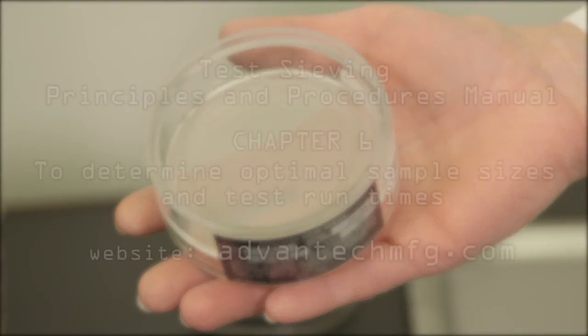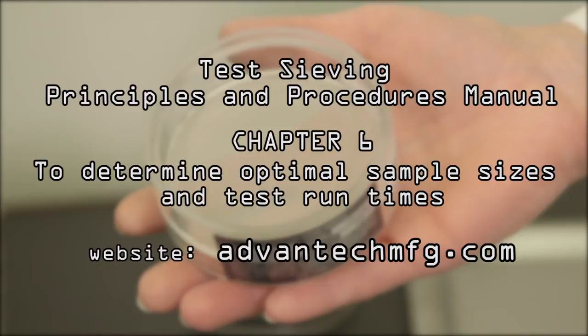Again, for more detailed instruction on determining an optimal sample size and test run time, please refer to Chapter 6 of our Test Sieving Principles and Procedures Manual on our website.